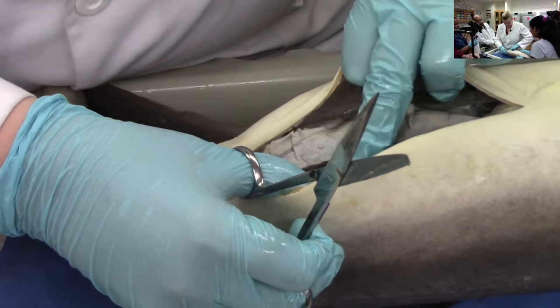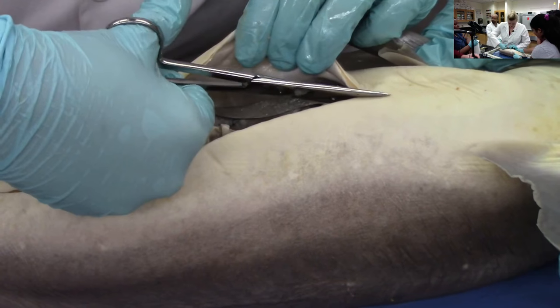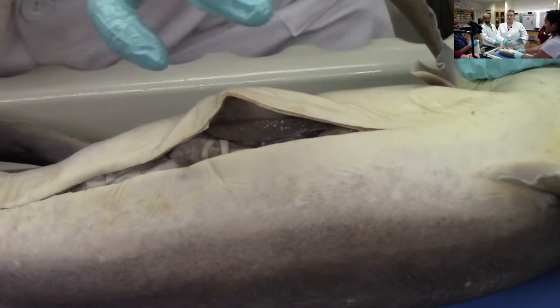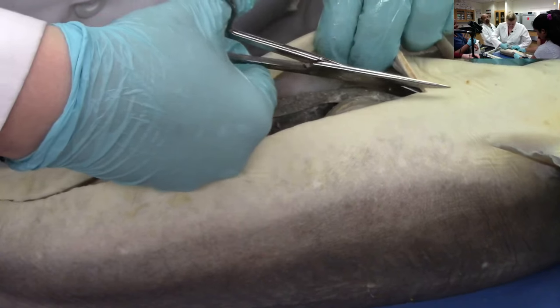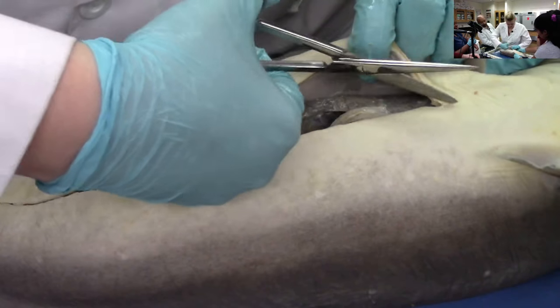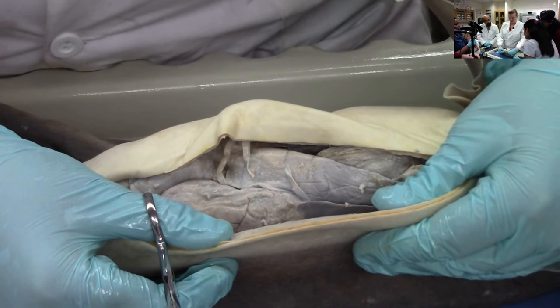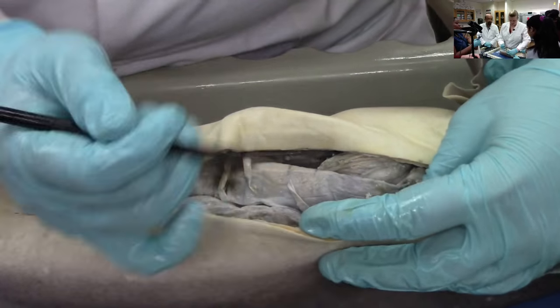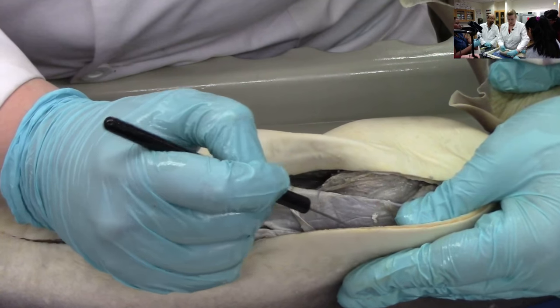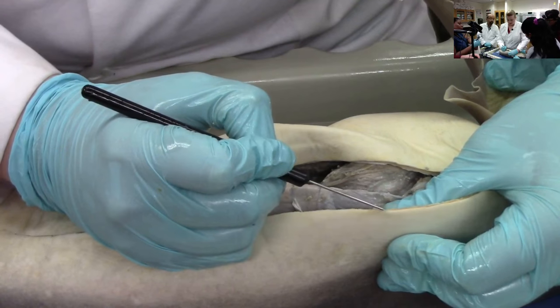This is called the coelome. She's got some babies in there! The skin's not actually that thick. Look here, you can see the layers — this is the peritoneum, which is the lining of the gut body cavity. And then this is the muscle, and then this is the epidermis.